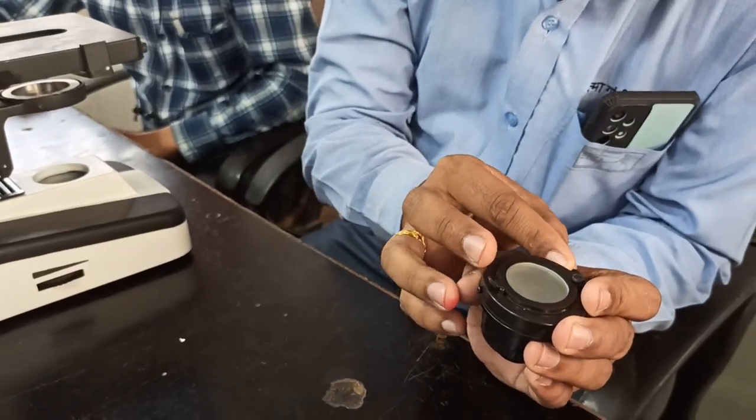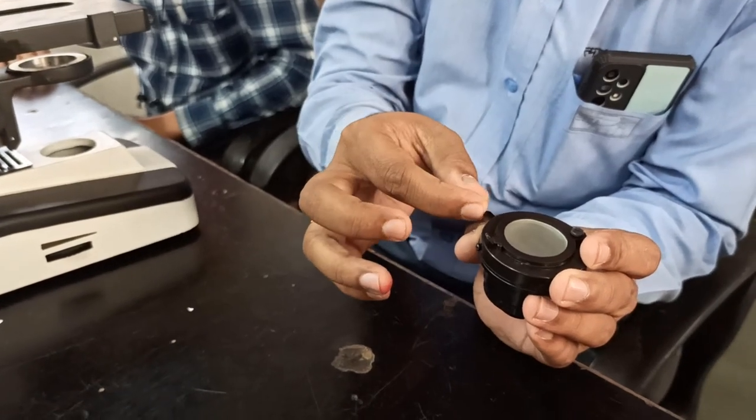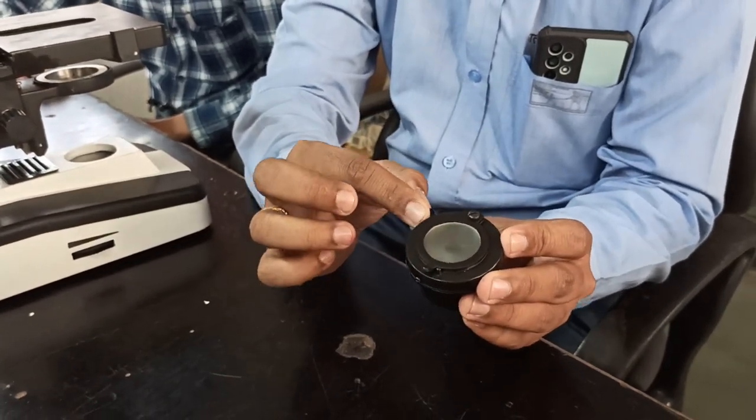Sometimes the doctor will complain that light is not coming from this, right? So at that time you have to just open it. Sometimes the doctor makes one mistake: it is completely closed, so that's why light will not transfer from this. So at that time you have to make it open, right?